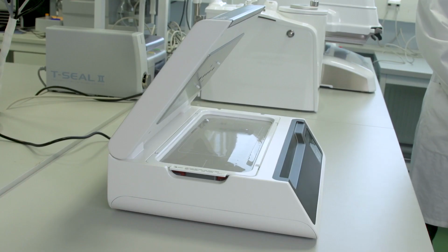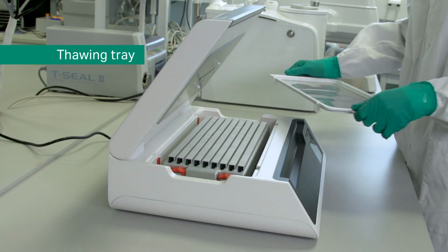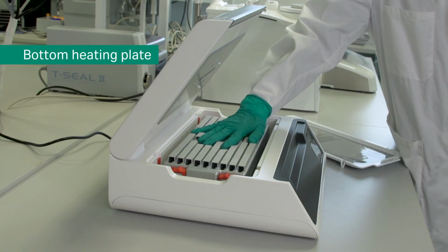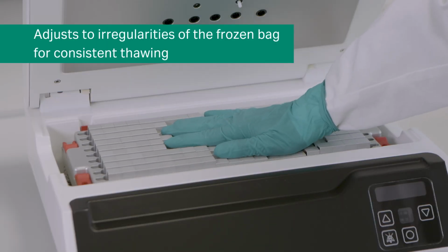Below is the thawing tray, where the bag is placed for thawing. The tray can also act as protection in case of spillage. The thawing tray is removable. Underneath it, you can see the bottom heating plate. The bottom plate construction adjusts to the frozen bag morphology, if not perfectly flat, and moves up and down to accommodate different bag thicknesses.